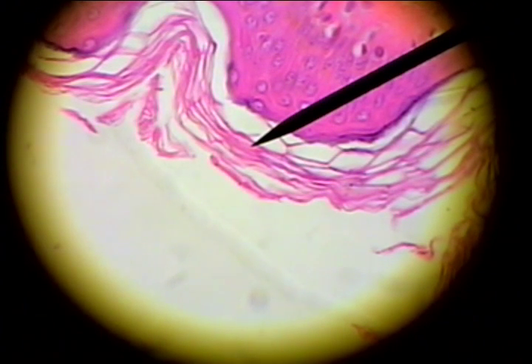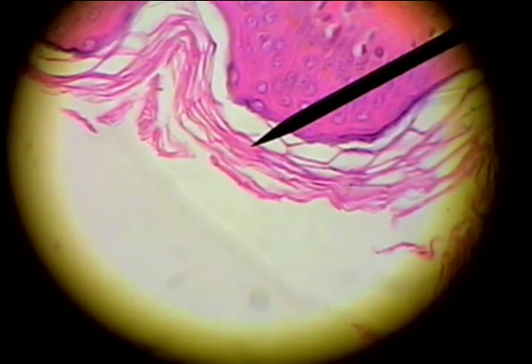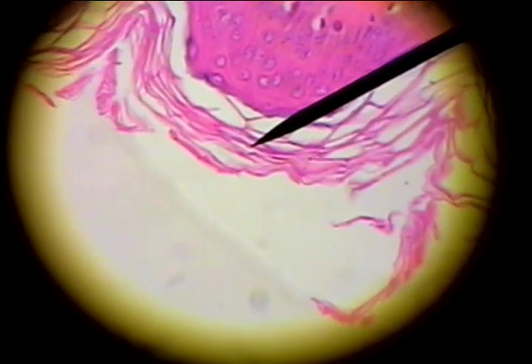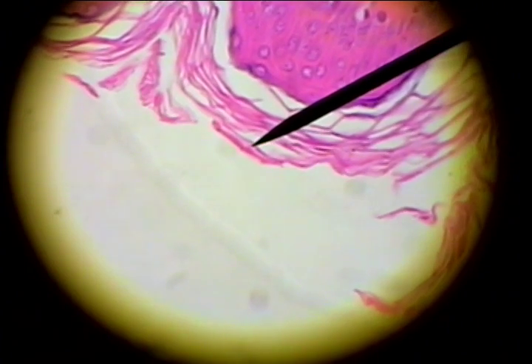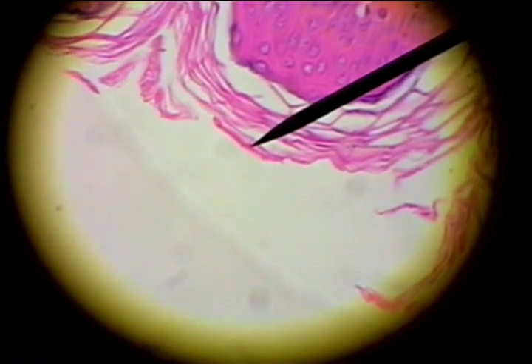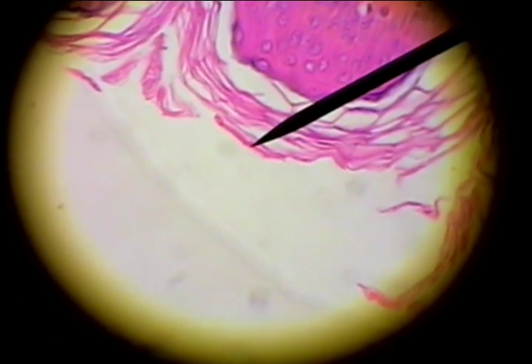This tissue is skin, and it's thin skin. We see on the surface a thin layer of non-living protein, the keratin layer — the stratum corneum.